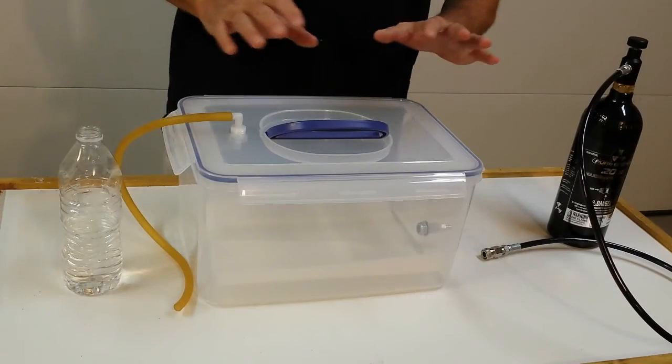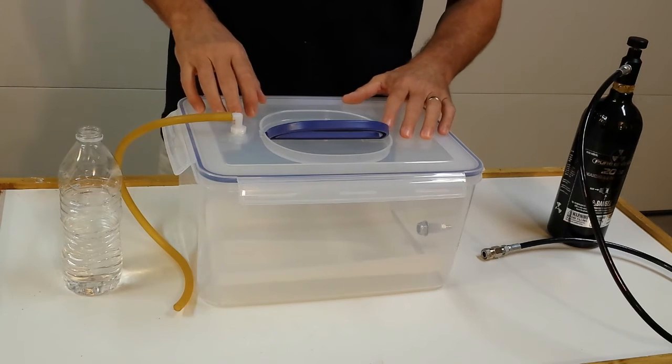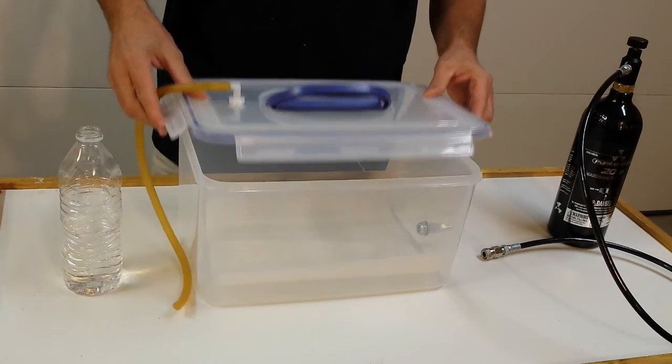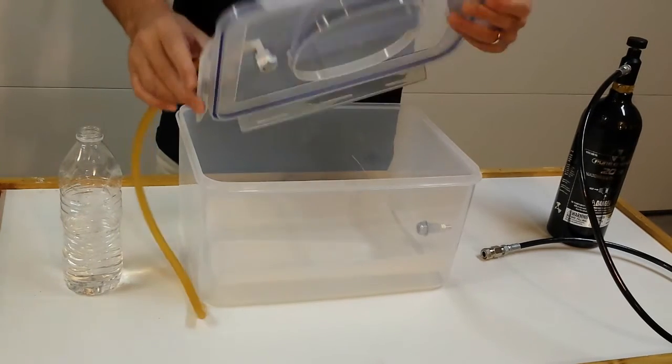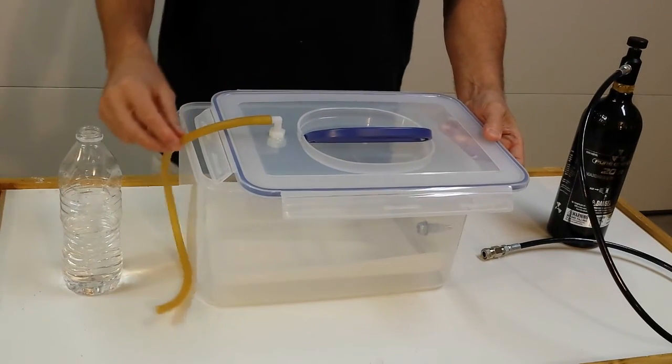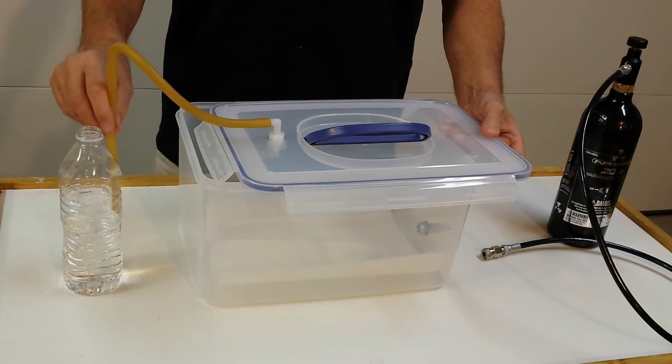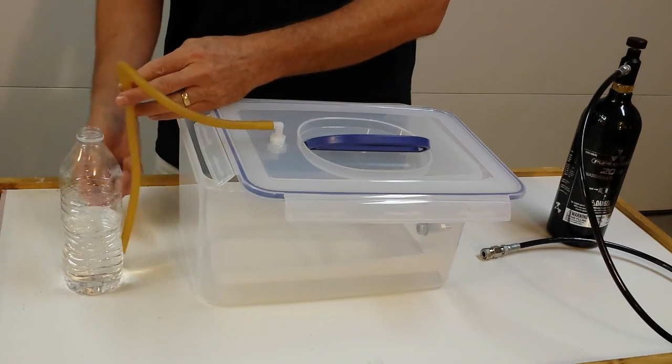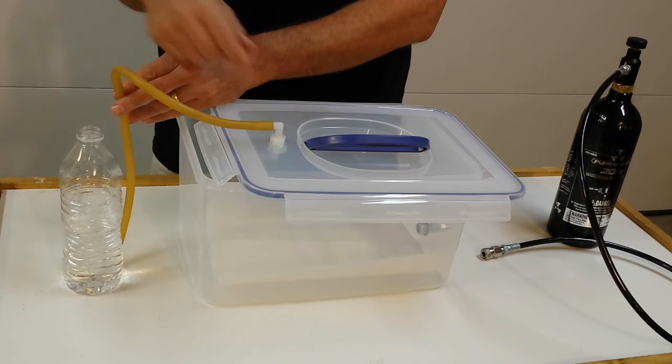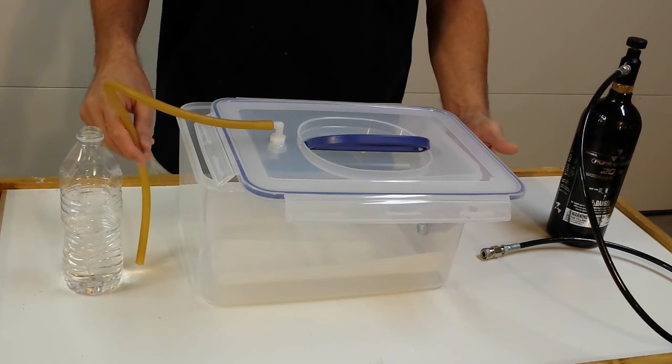Okay, so now that you have all parts, you can see how it's kind of put together. I'll start with the little cap on the top. This is a little hose that runs out. That goes into a little jug of water. That's to keep any oxygen from back flowing into the chamber after you've loaded it with carbon dioxide.